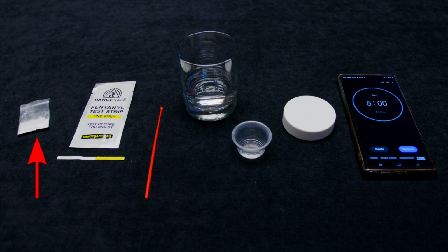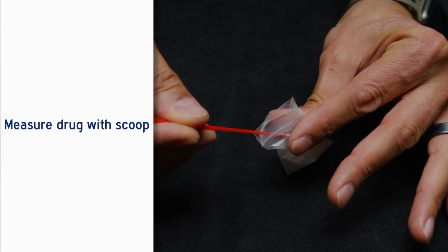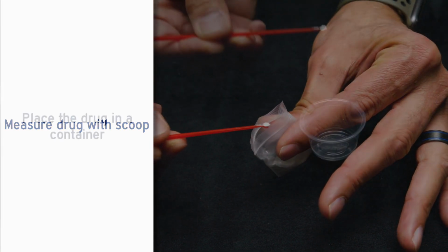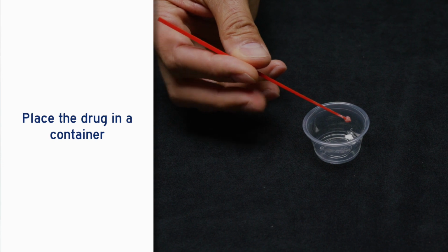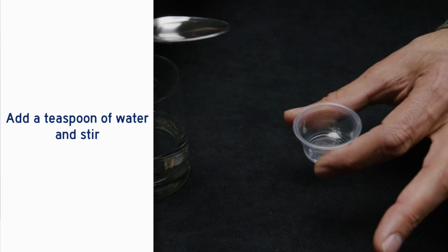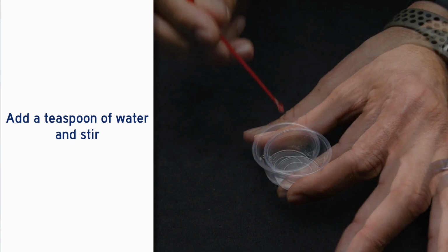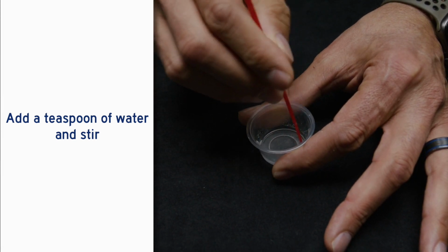To test, you need the drug you will be using, a fentanyl test strip, a stirrer, a small amount of clean water, a small clean container like a bottle cap, a flat hard surface, and a watch or cell phone for a timer. Take a small amount of the substance, just a few grains. Place the substance in the container. Add a teaspoon of water. Stir until it is completely dissolved.